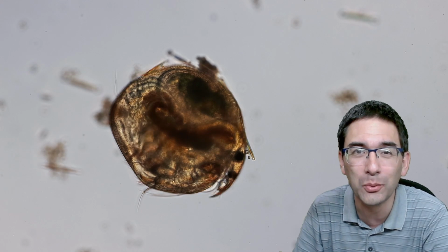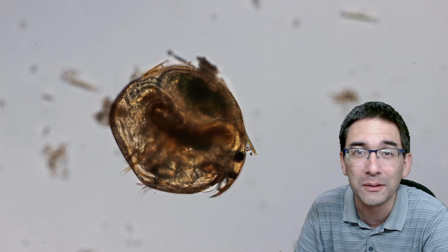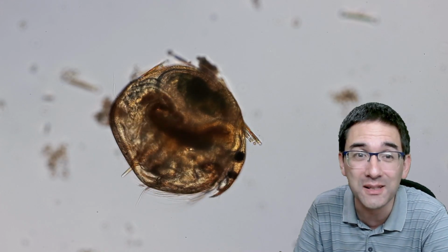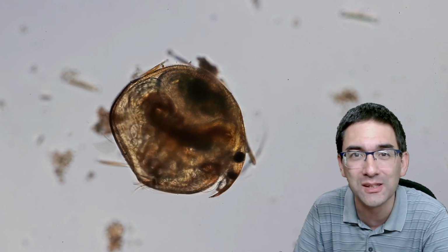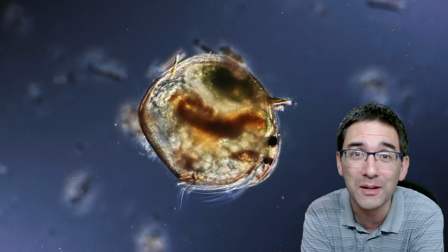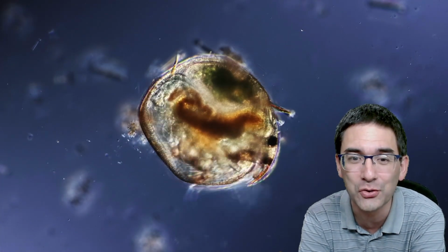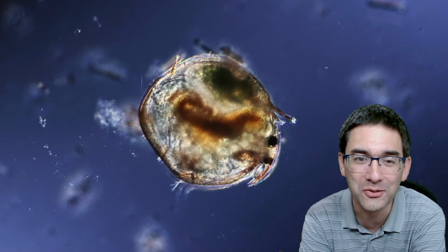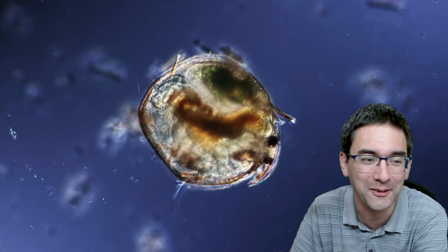In an upcoming video, I'd like to put those Artemia brine shrimp under the microscope. They're the so-called sea monkeys, as they used to call them. So I'm going to start breeding some of those water crustaceans myself, in this case in salt water. Here's another one. As you can see, I was trying to experiment a little bit with the different contrast settings of my microscope. But it was quite nice to see them. You can actually see this one also releasing something here.